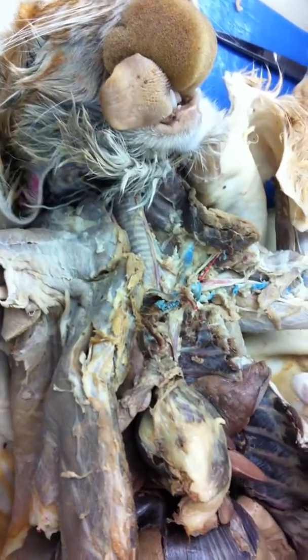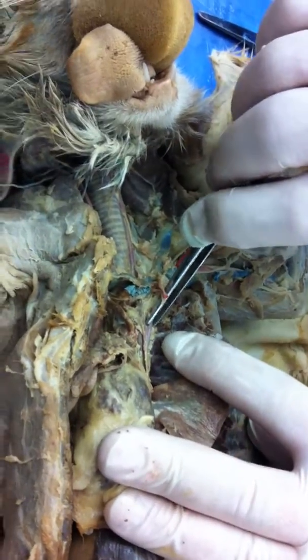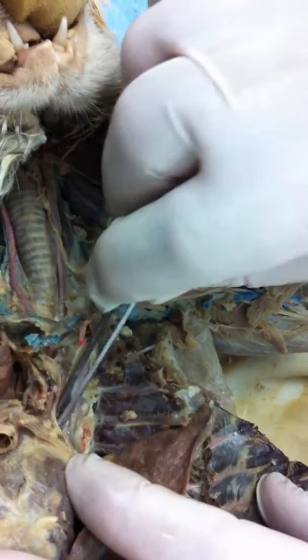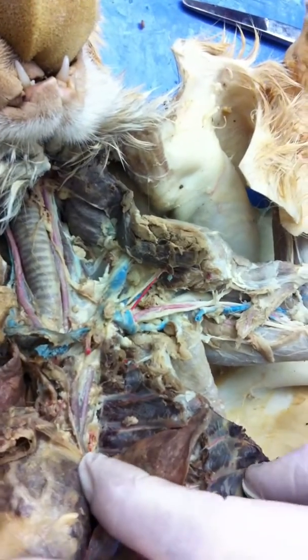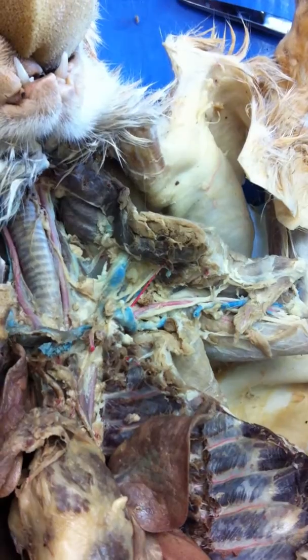Yeah. But I don't think that's one you had to know, is it? It's marked off. But at least we have found the aorta, and we have found the who? Left subclavian. Which means there's also right subclavian. Now, what is this thing then? It's fat and it's in the middle. Yeah, it is the brachiocephalic artery. You're looking at the brachiocephalic.